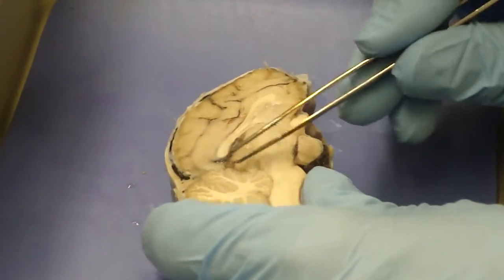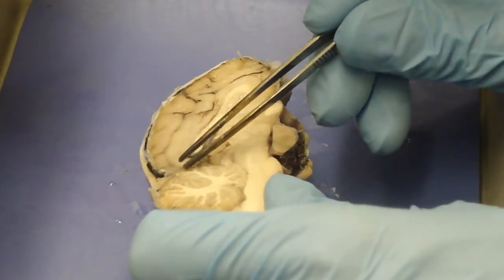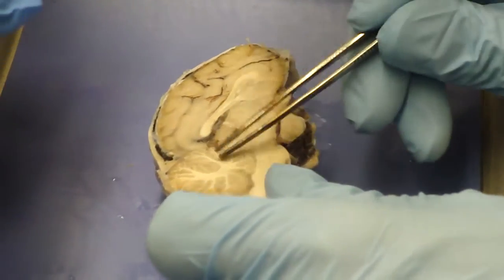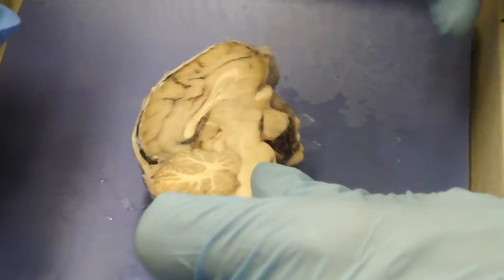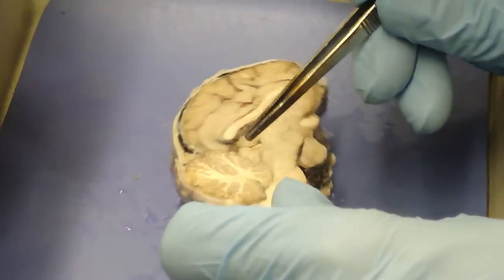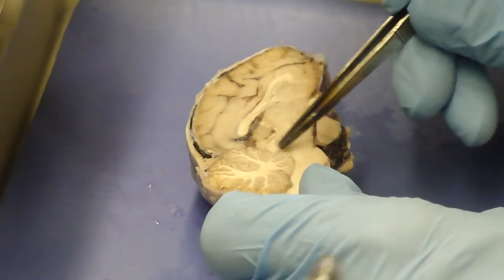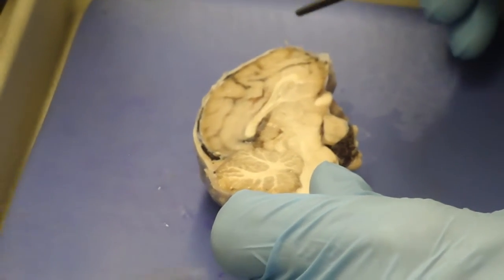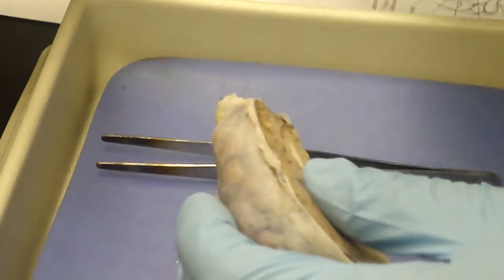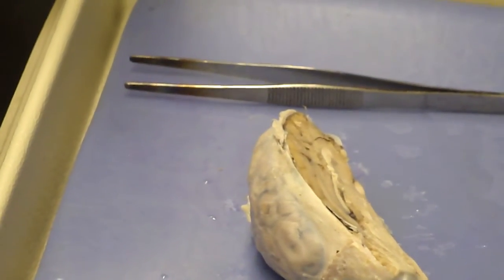Now, you'll notice that the cerebellum has a color difference. There's a kind of tree in the middle and darker tissue around the outside. Wherever you see the whitish color, that's telling you that they're myelinated neurons. So in the cerebellum, we have white matter on the inside, and the darker gray matter is on the outside. Now I can also show you that that's the case in the cerebral hemispheres. Let me just cut through this.